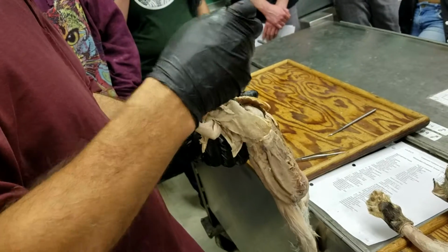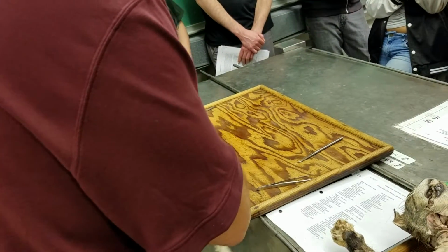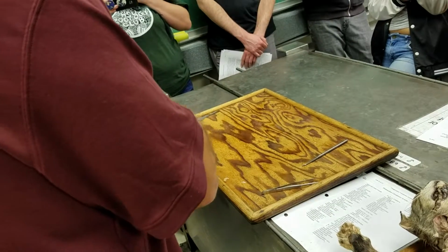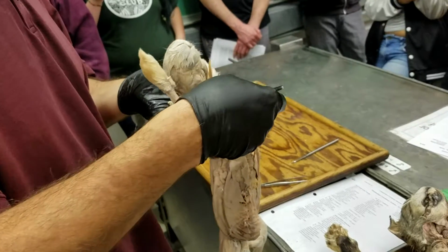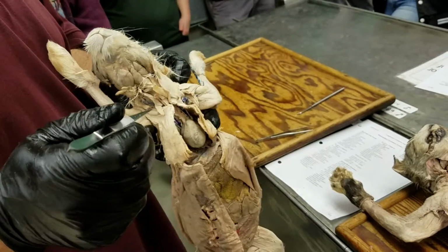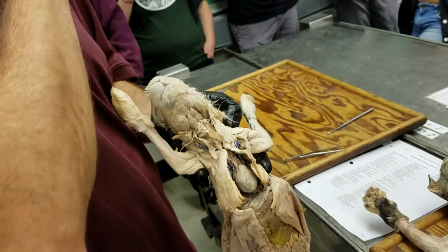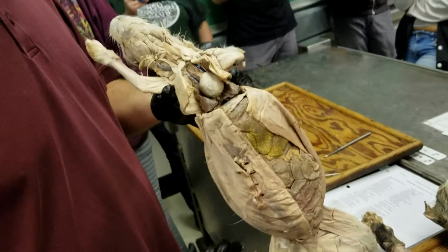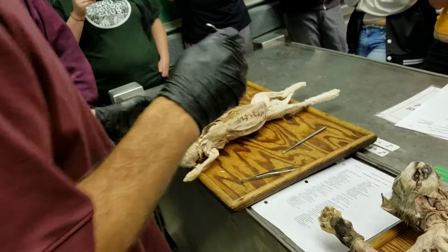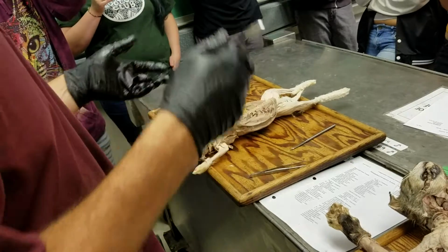And then if we follow that out into the limb here, there it is. Right there in the limb, that's the brachial vein. And so this vessel basically gets three different names depending on what region it's in: brachial vein, axillary, or subclavian. What does subclavian mean anyway? Under the clavicle. Yep, exactly. So in us, that's right here. And just like there's subclavian, axillary, and brachial veins, there's also the same things as arteries, running along in the other direction.